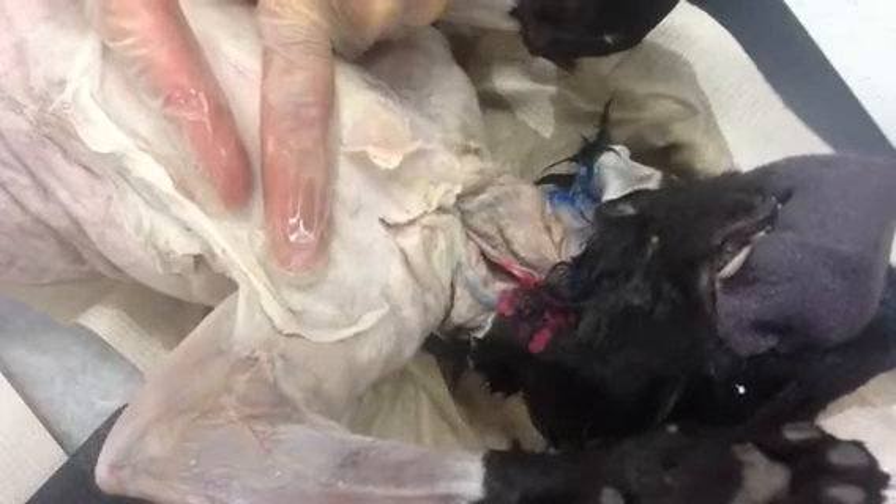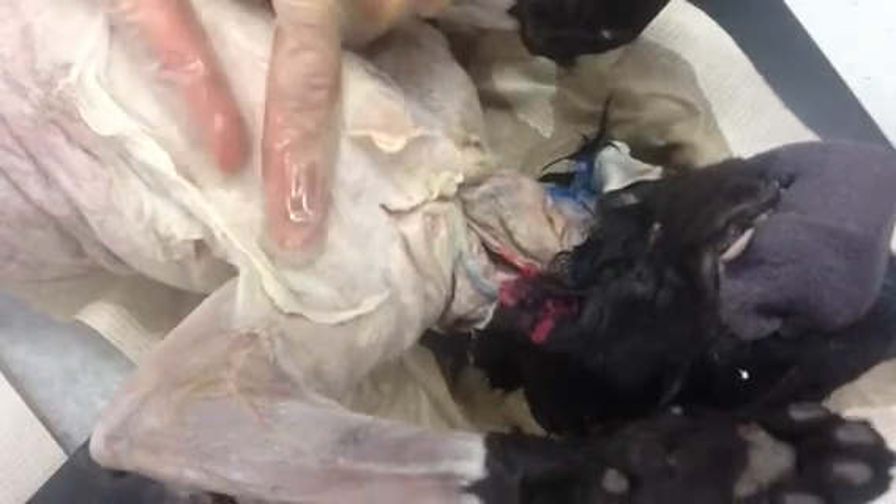I now know that I'm getting more muscle because when I stretch this out, I can see fiber directions. I can see the arrangement of the fascicles — the bundles of muscle fibers. I can see right here the direction is like this, and then I have almost a line right here, and then the direction is slightly different. So I'm going at this angle and this angle — similar, but not exactly the same. So two different muscles.